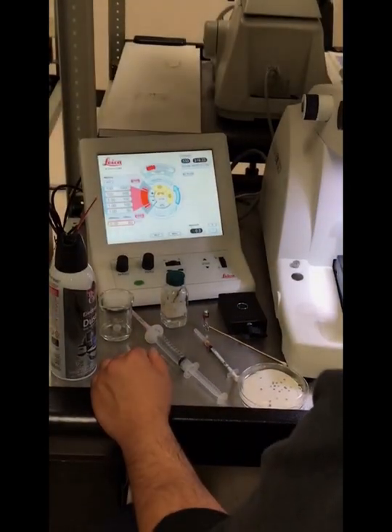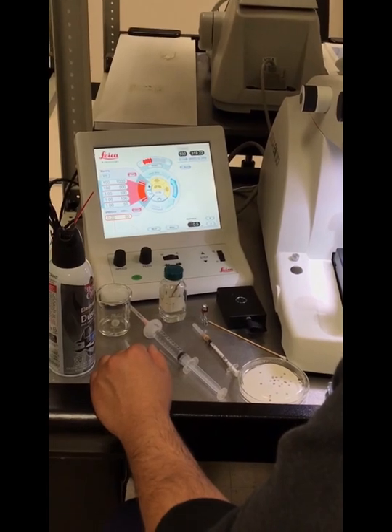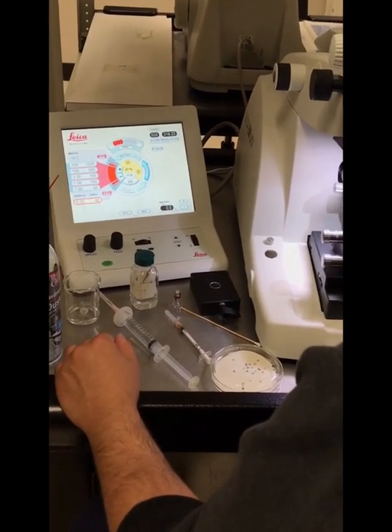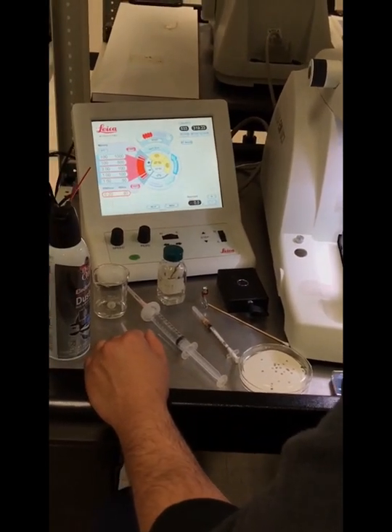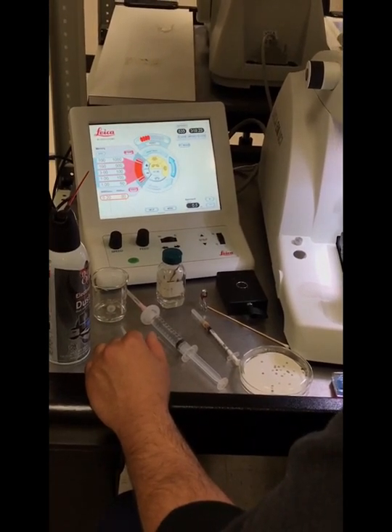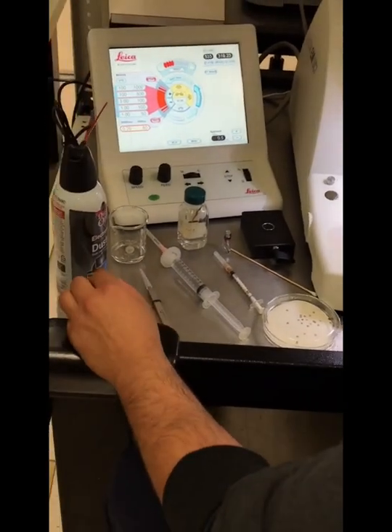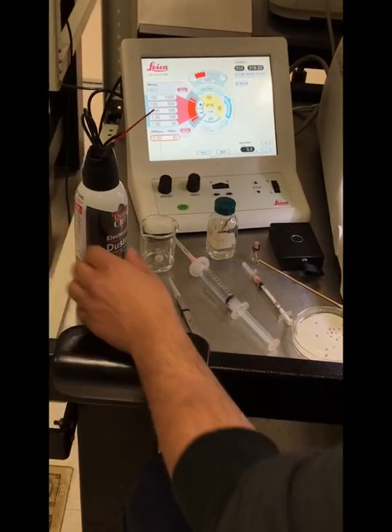Hello, today we'll be doing a demonstration of ultramicrotomy on the Leica EMUC7 ultramicrotome for thick and thin sections for electron microscopy. So to start, we have some materials here that we need to gather for the procedure.